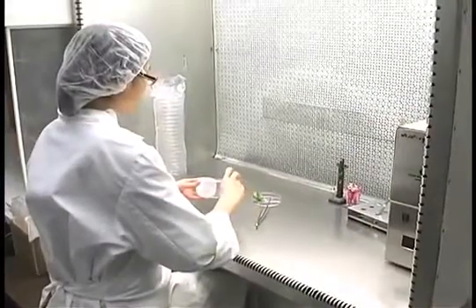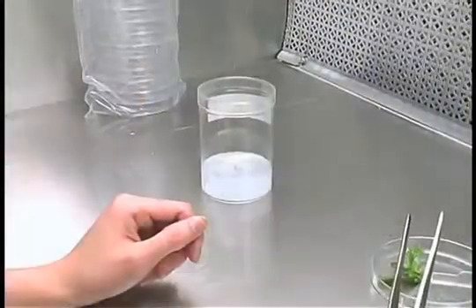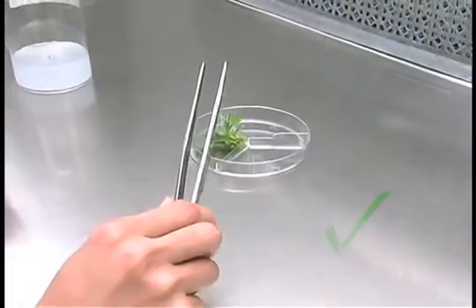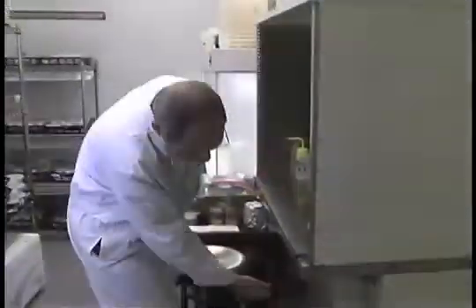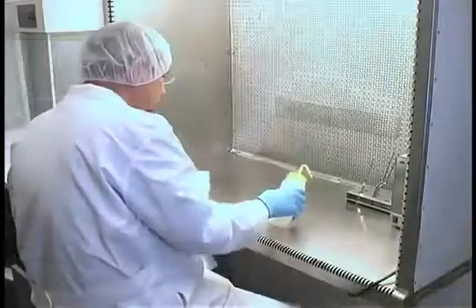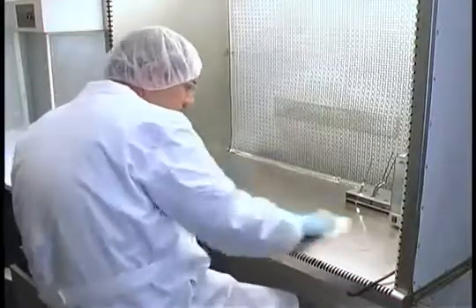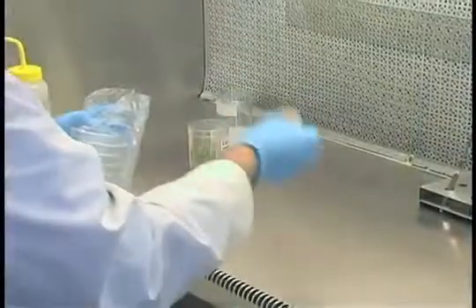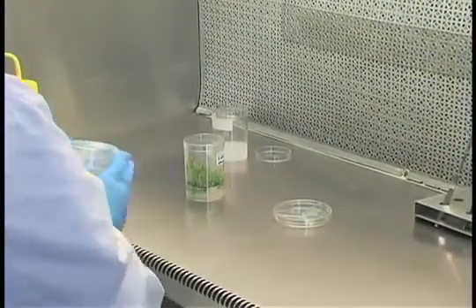Have only the necessary items in the sterile work area. Remove items that are no longer needed as quickly as possible. Think about each step before beginning so that you understand what you are about to do. Turn on your hood and spray or wipe down the hood and transfer areas with 70% alcohol approximately 30 minutes before starting to make transfers. A sterile work surface is needed on which to place the sterile tissue to trim it, and a sterile petri dish is a convenient surface upon which to work.